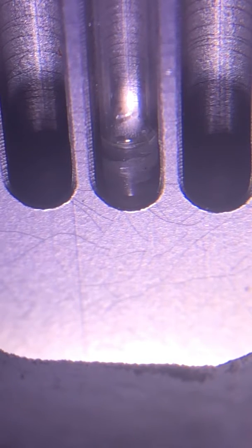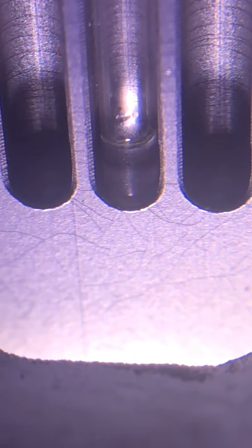Sometimes what you see when you have a little bit too much sample in there is actually you're seeing the thermal mass of the sample. That is you have a lot of material in there, 123.1, and it just takes more time for that to melt and so sometimes you have to be a little bit careful.